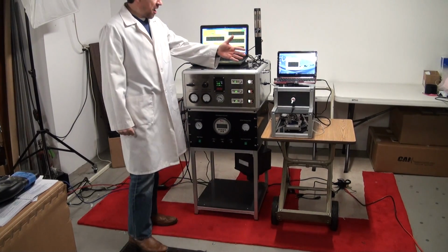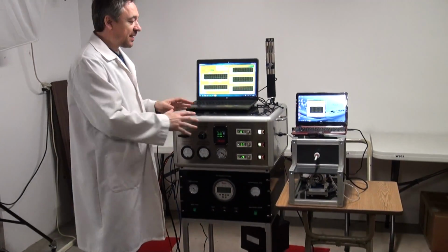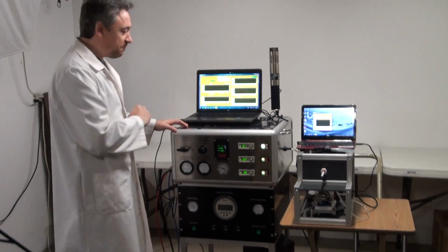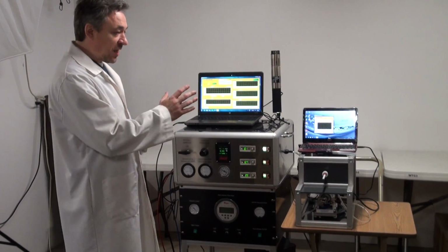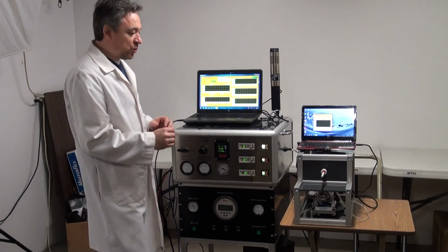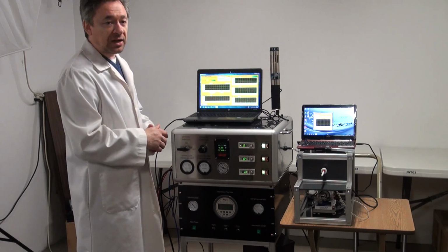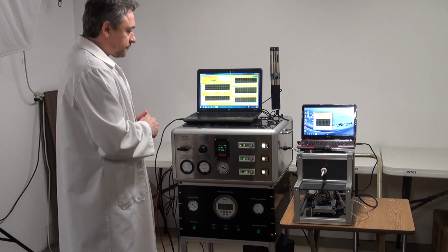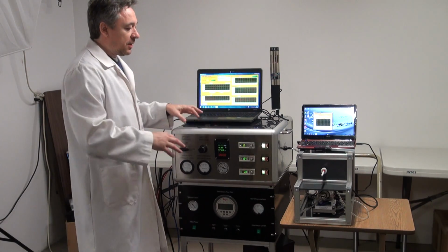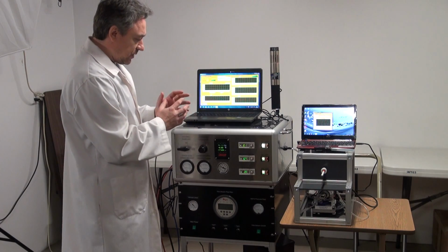Okay. We have here a cigarette smoke generation system coupled with a concentration control siphon. It can be used for either cigarette products or e-cigarettes. The siphon basically works this way.